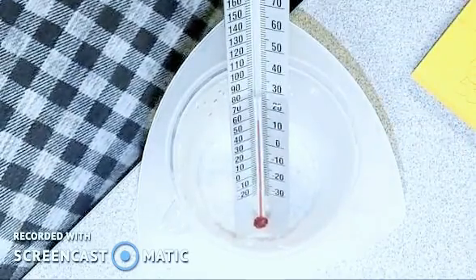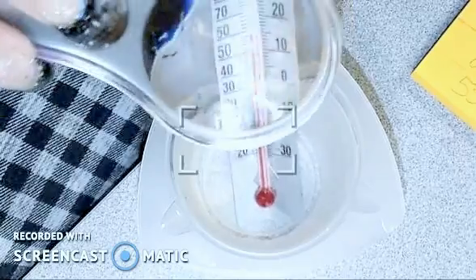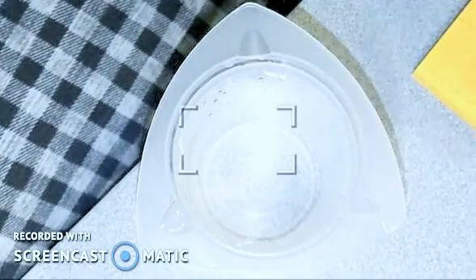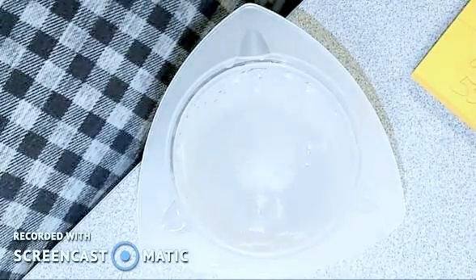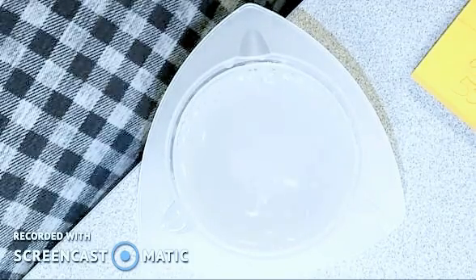Hey, just out of curiosity, I got to be careful because I don't want to run out of time. Would it have been easier to see? Oh yeah, look at that. That was the whole point of the hand lens. Yeah, okay. Ready, set, go. Still bubbling.